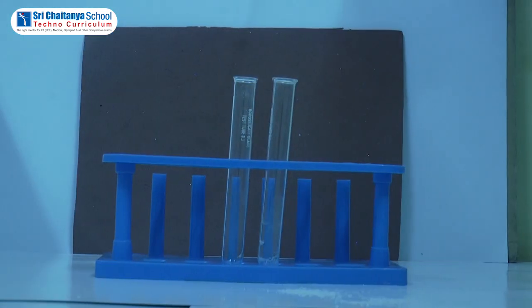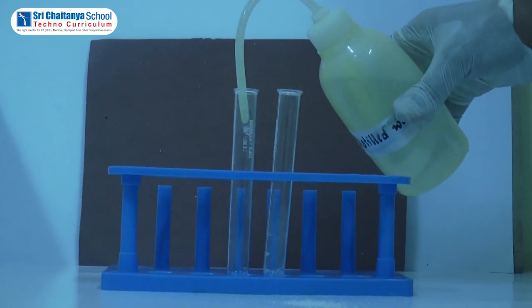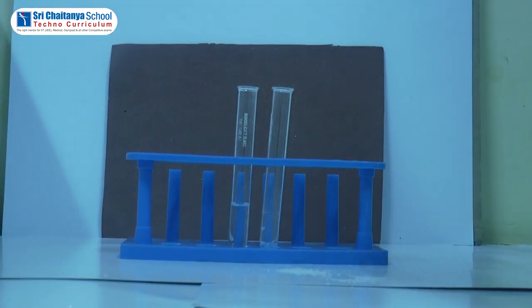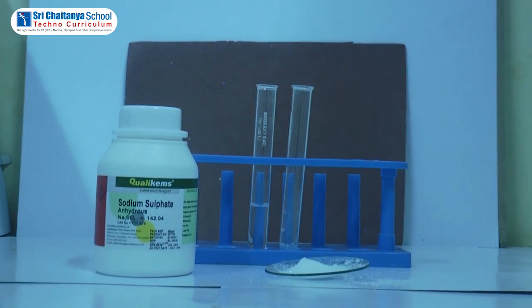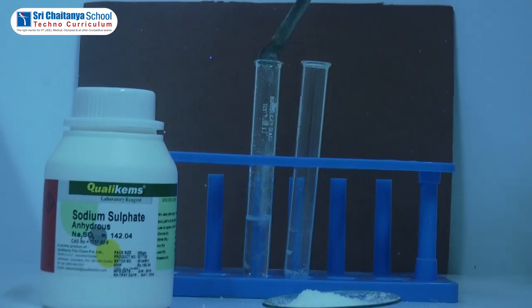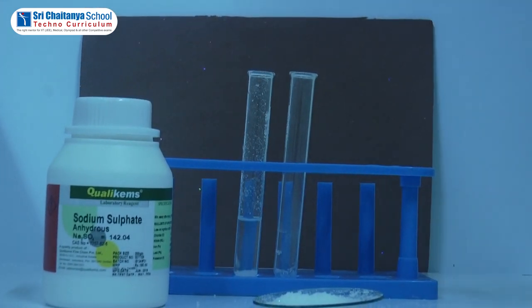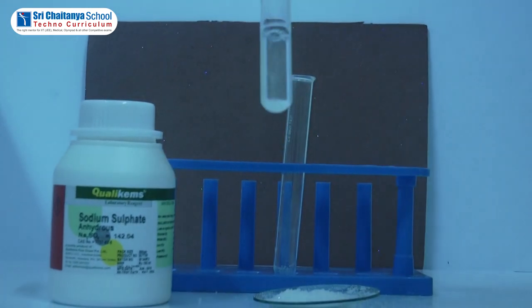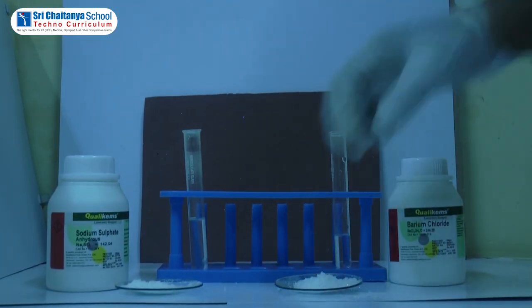My dear students, now we will go through the procedure. Take a few drops of water in a test tube. Dissolve a small quantity of sodium sulfate, Na2SO4. Dissolve a small quantity of barium chloride, BaCl2, in distilled water.